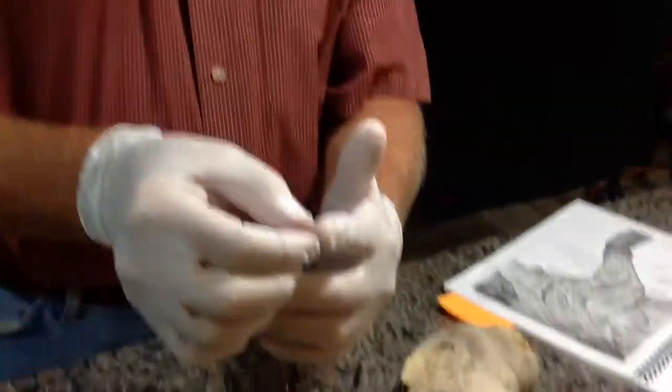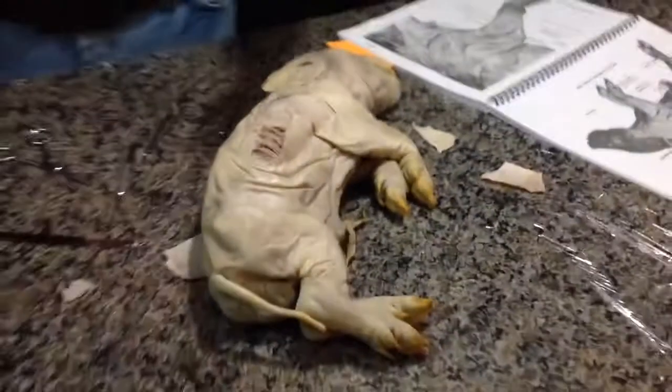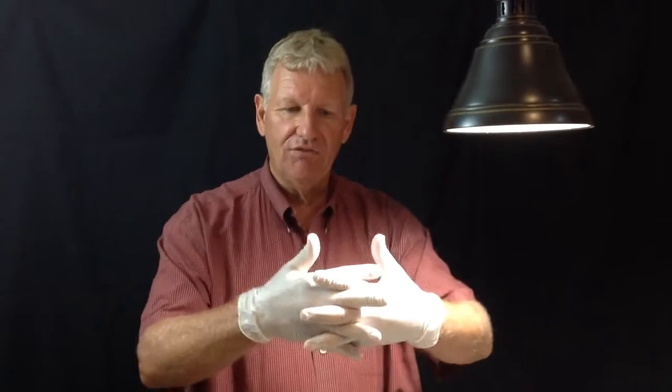And so why all the fibers? The reason for the fibers is, this is the way a muscle works. A muscle actually is a bunch of strands of fibers that pull like this. They slide as they go. So they give you strength. When the muscle is tightened, here are the fibers right here. When the muscle is loosened, it's right here.